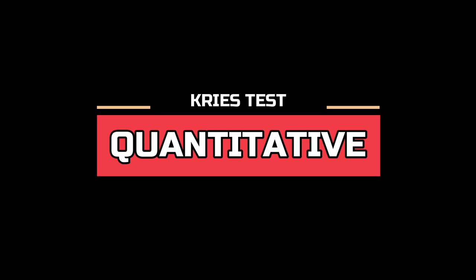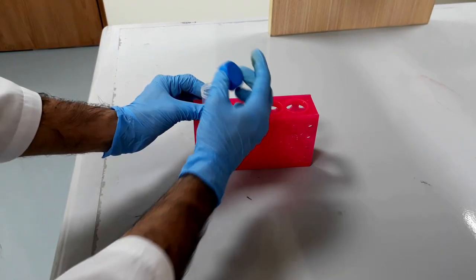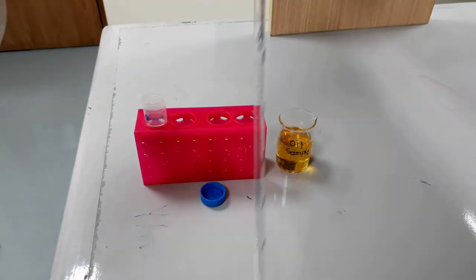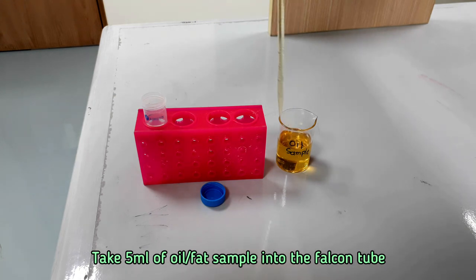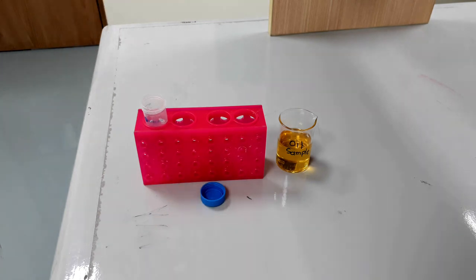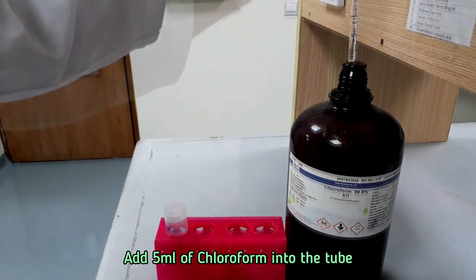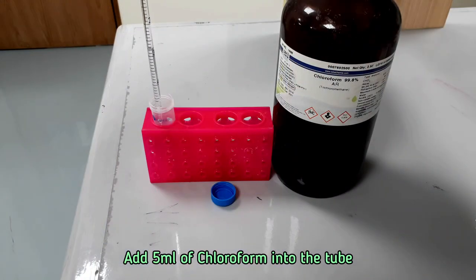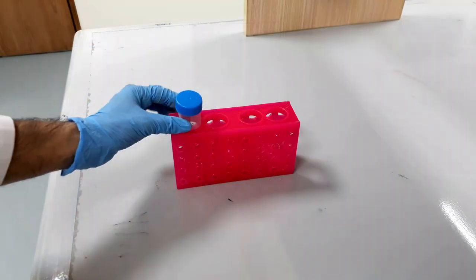Now let's conduct the quantitative test. Bring a clean and dry falcon tube and the oil sample for sample preparation. Take 5 ml of oil sample into the falcon tube. Add 5 ml of chloroform into the tube. Close the tube with the cap and shake it to mix the content properly.